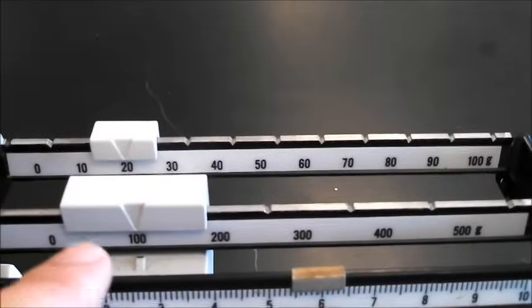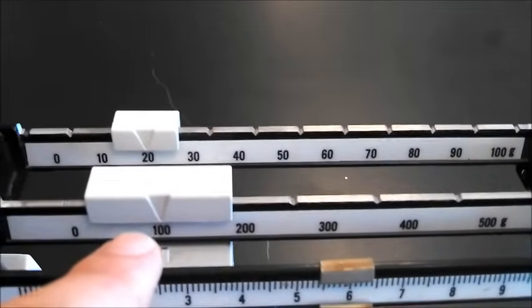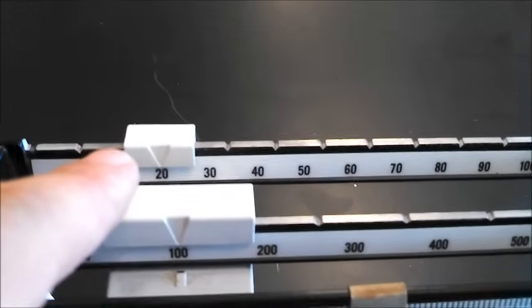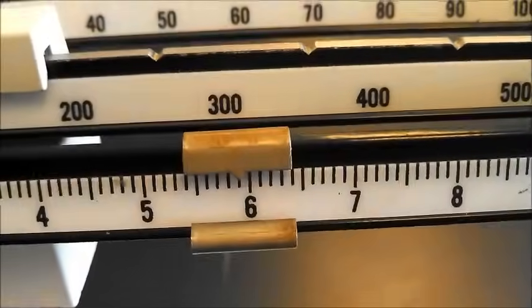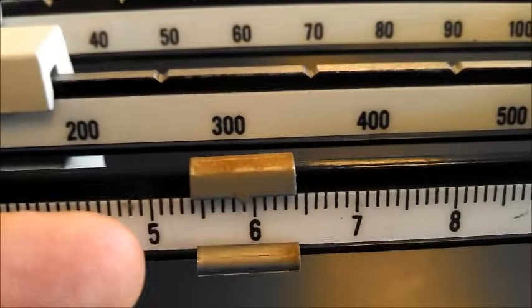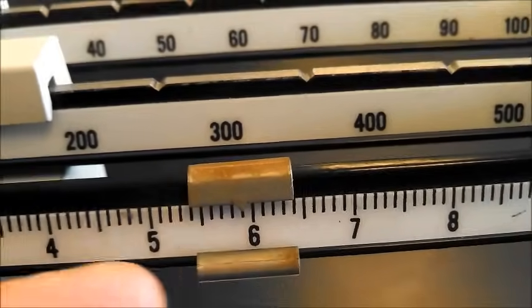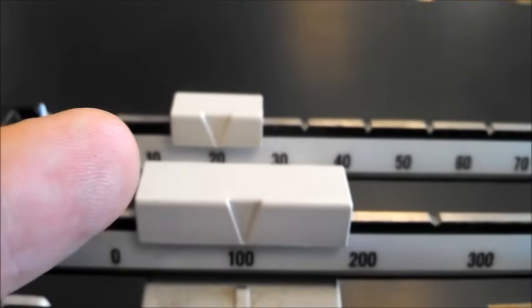Let's look at the largest one first, 100. So that's 100, 20, 120, and what's this one? Well, it's right after the 5 before the 6. So that's going to be 125.